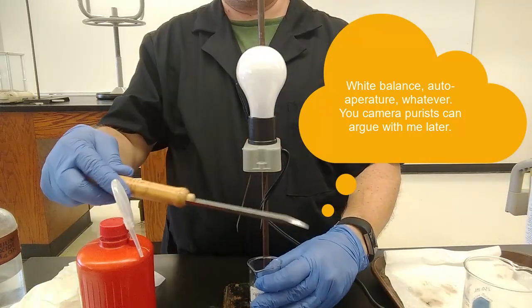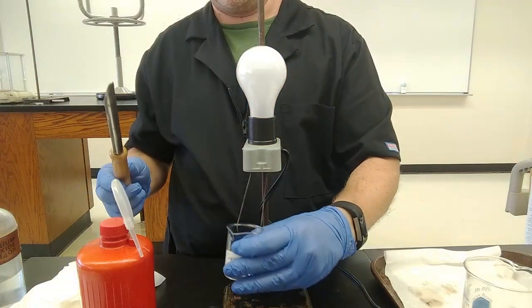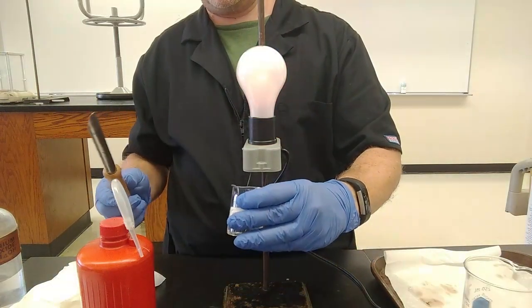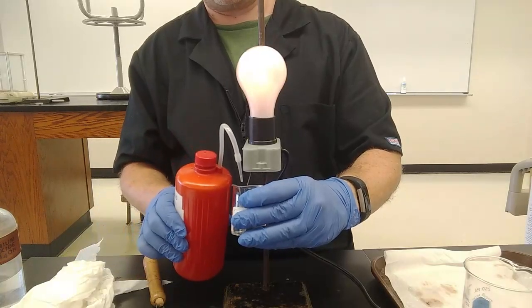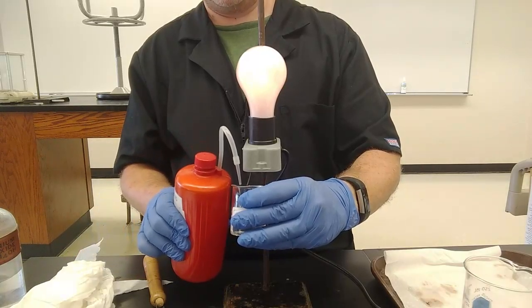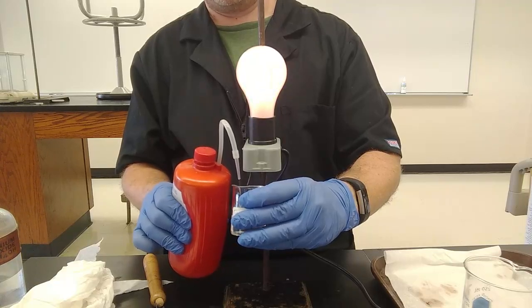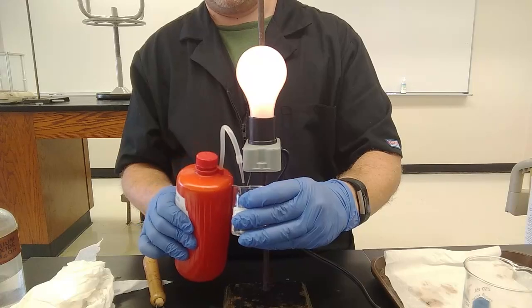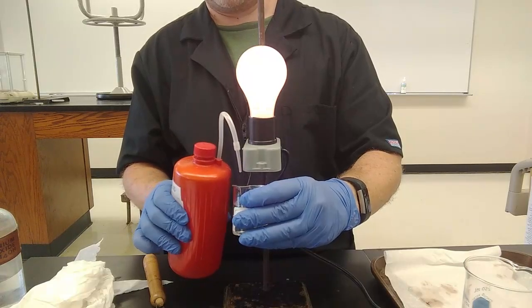Here's conductor. Here is weak electrolyte. Let's see what happens. Oh, I gave you the answer. Weak base. Let's see what happens as I add more water. Brighter and brighter and brighter.